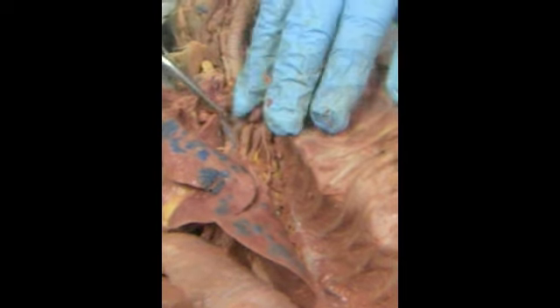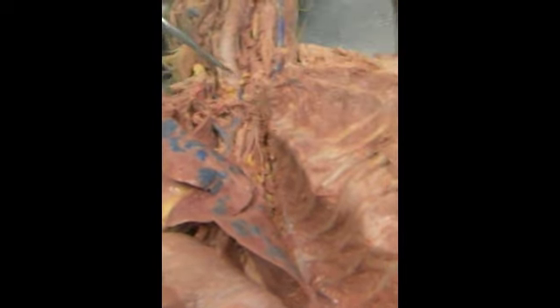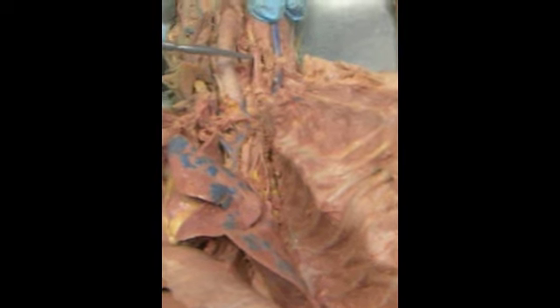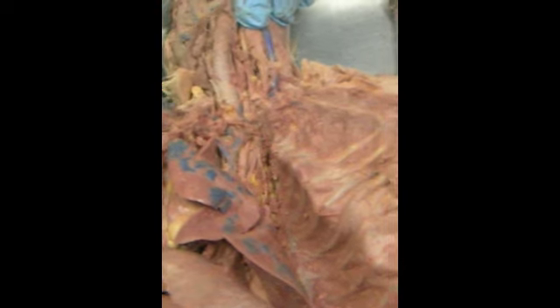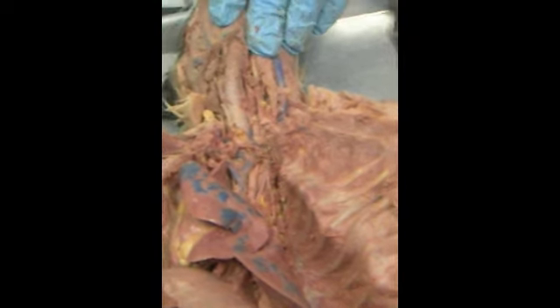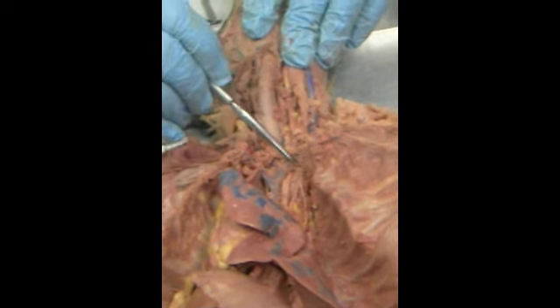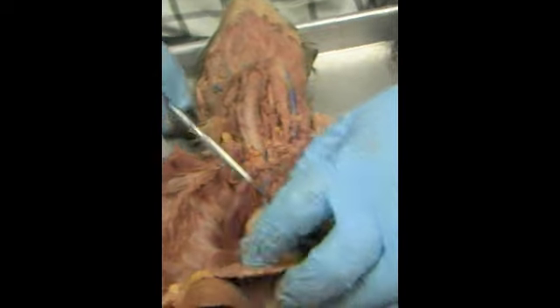This will branch up. It's lost underneath the veins. We will have our, right here, carotids. It'll then branch off and become the right subclavian, which will then become the axillary and brachial. The left subclavian would come up, become axillary and brachial. Veins are much easier to see.